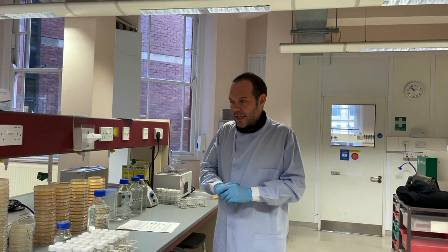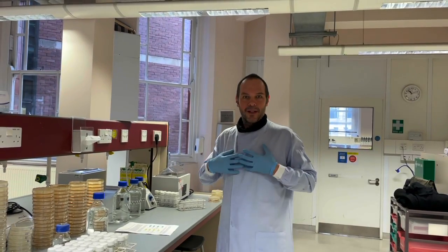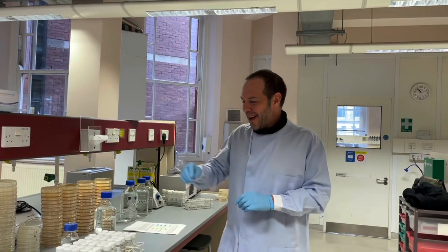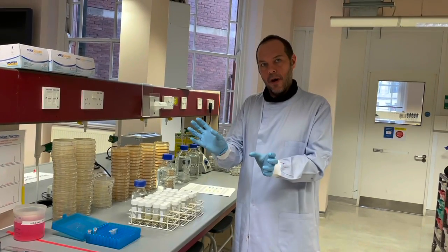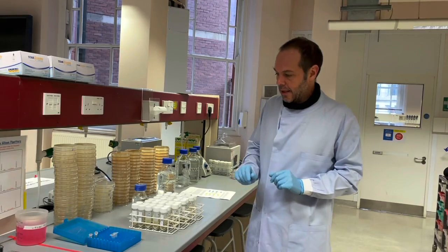So for this first incredibly simple experiment, I'm doing your experiments for you. I grew up 2 strains, which we can distinguish with genetic markers. I'll give you a bit more of the detail in writing, because that's easier to keep track of.